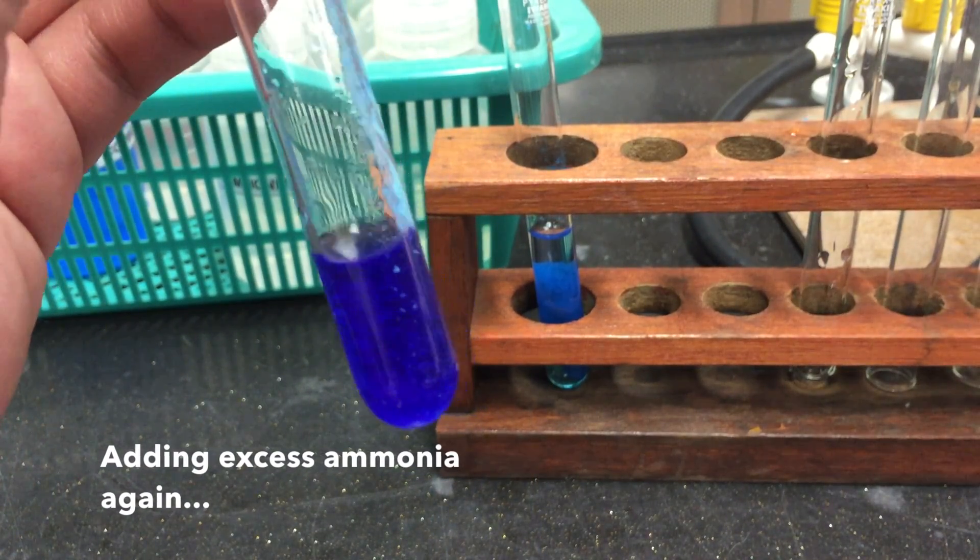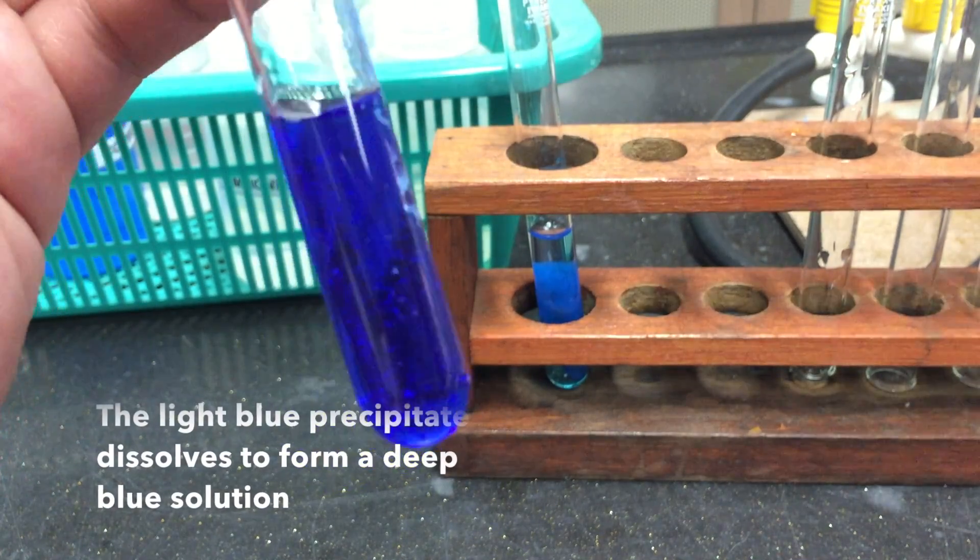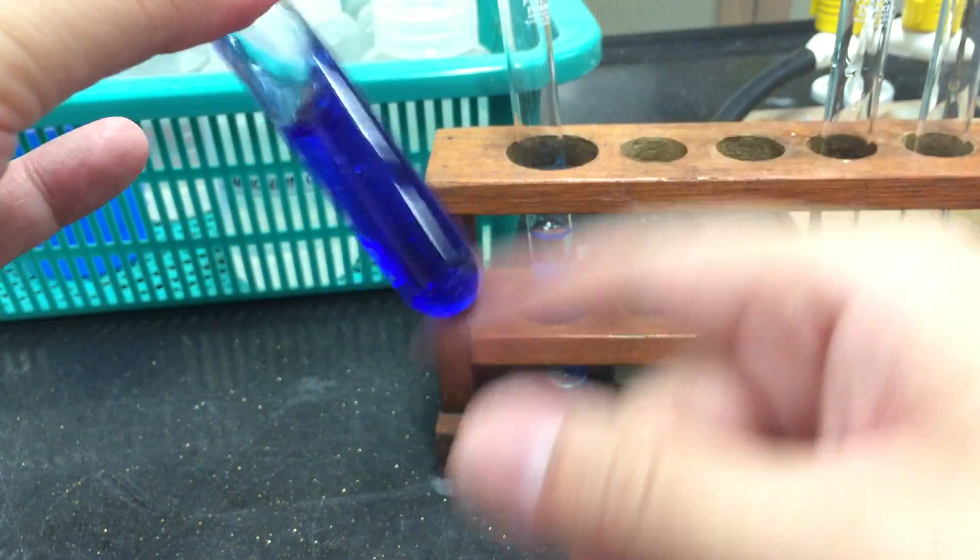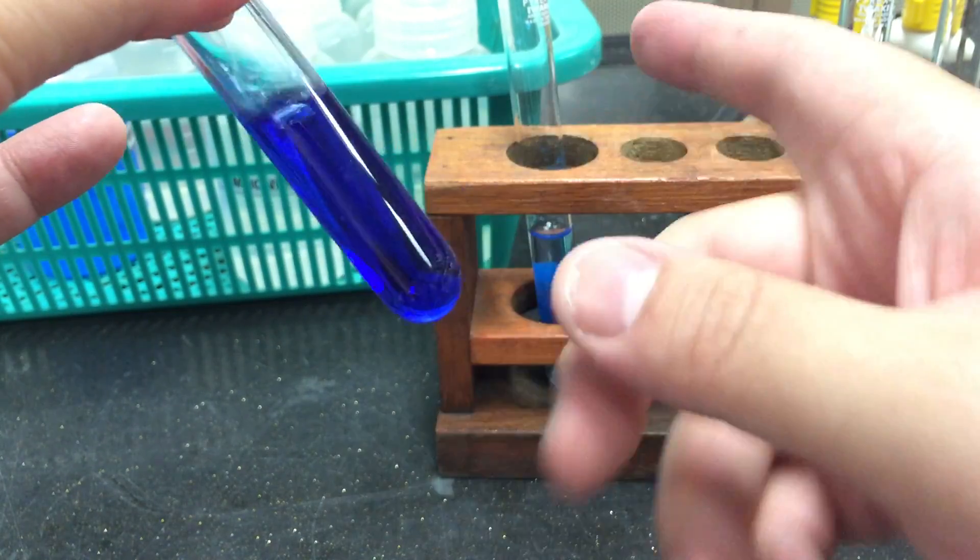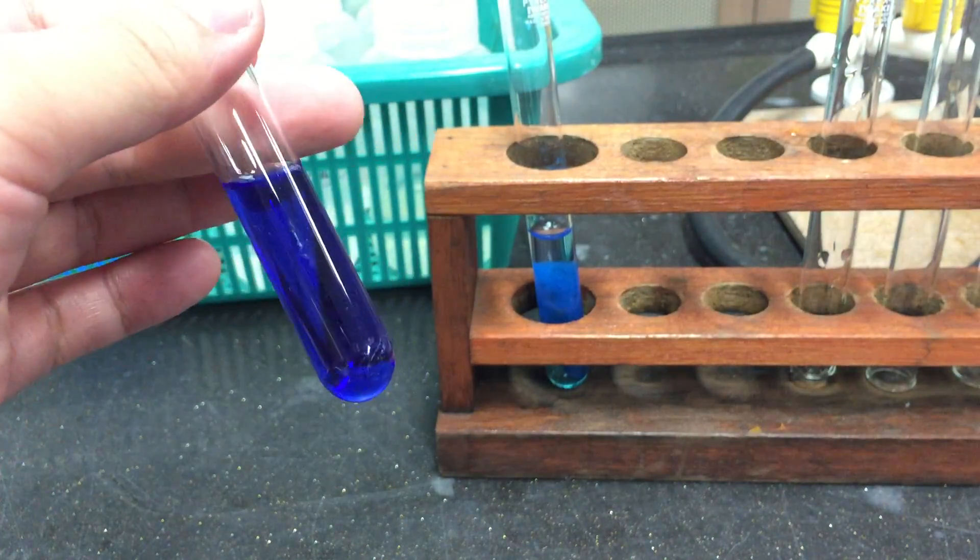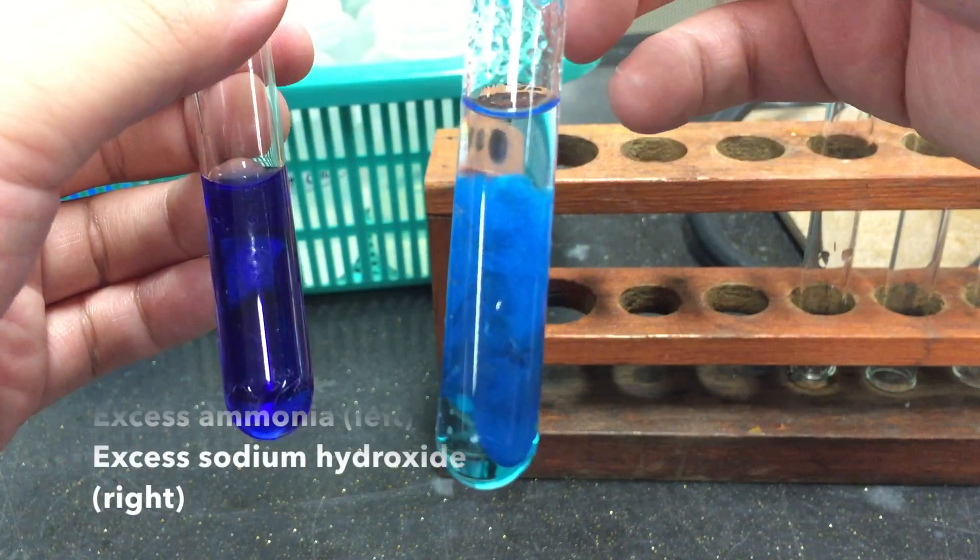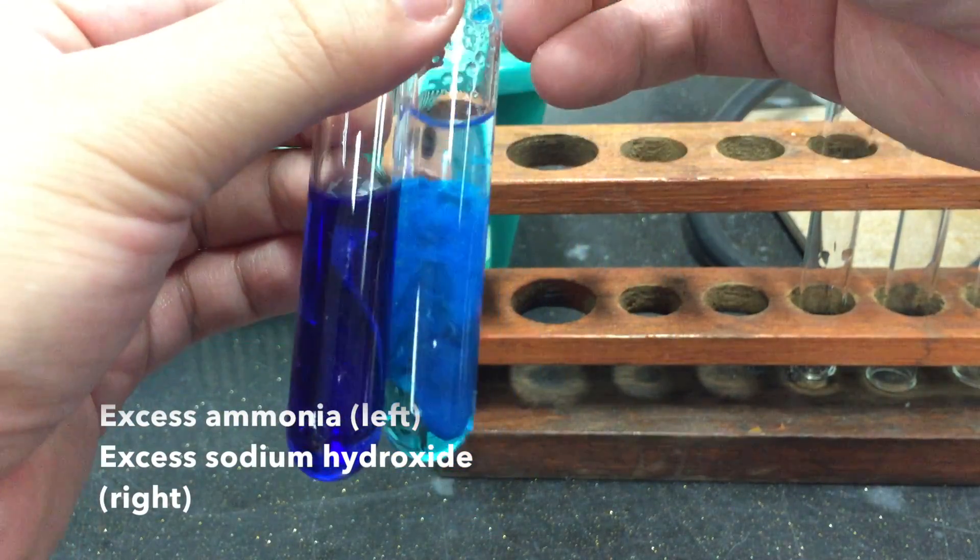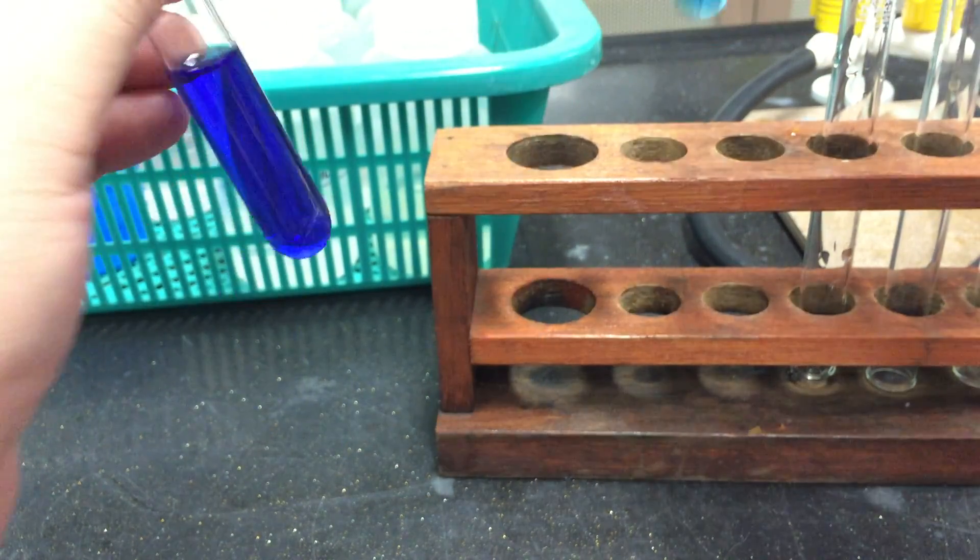This time, you will see very clearly that the light blue precipitate dissolves to produce a deep blue solution.